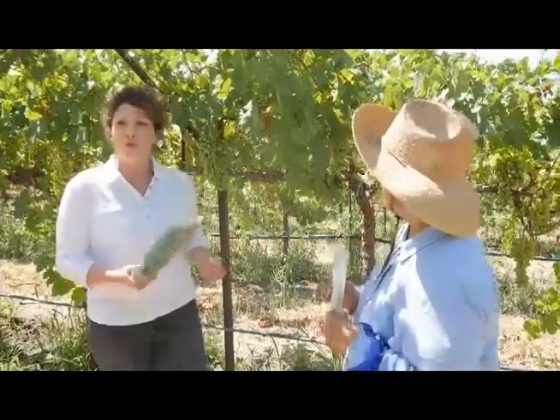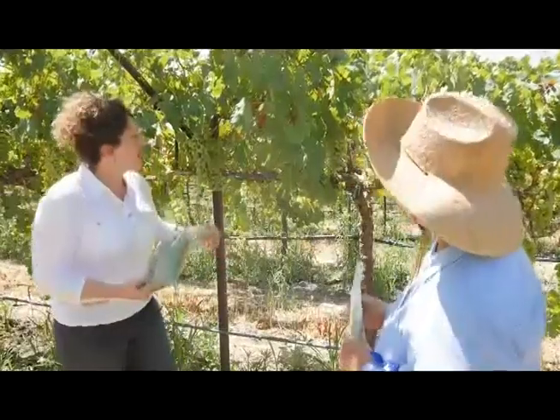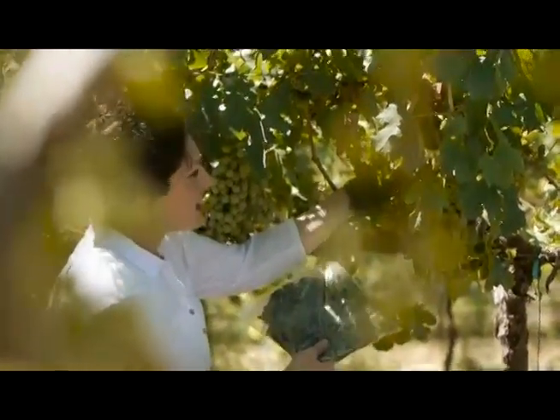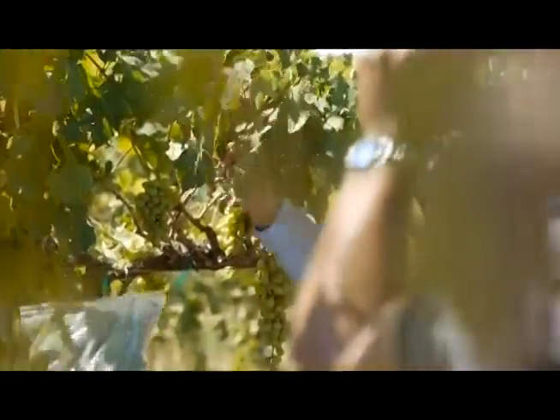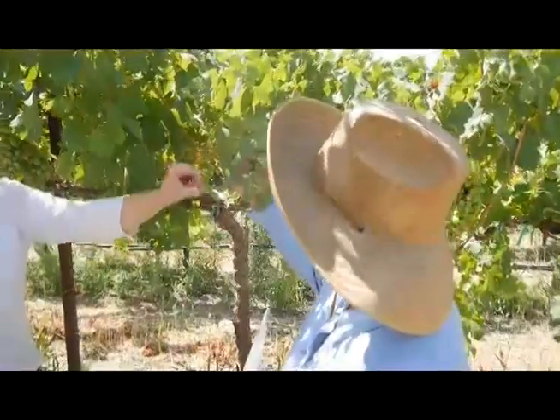So we're going to point out what old growth looks like on a plant. For vines, we find the old growth as the larger leaves seen here, closer to the main vine. Marina is going to point out an example of young growth that we would sample, which is typically closer to the ends of the vine.